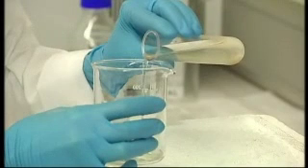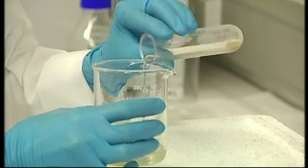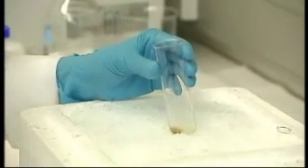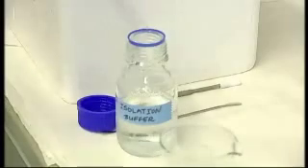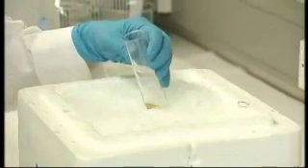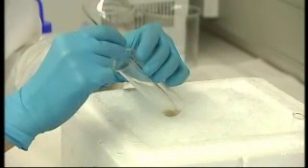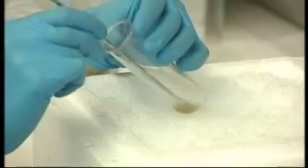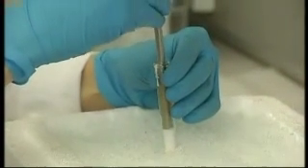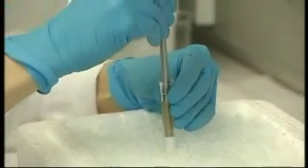After high speed centrifugation, discard the supernatant and rinse the pellet with buffer trying to discard the white fluffy outer rim layer. Add 1 ml of isolation buffer, tilt the tube from side to side and remove the rest of the buffer. Break up the pellet with a spatula trying to avoid the red spot of erythrocytes at the bottom. Re-suspend the pellet with a small homogenizer or alternatively by gentle pipetting.